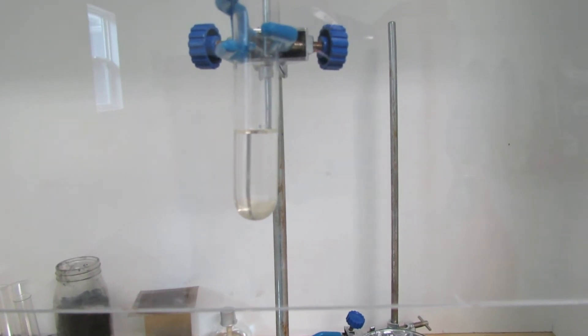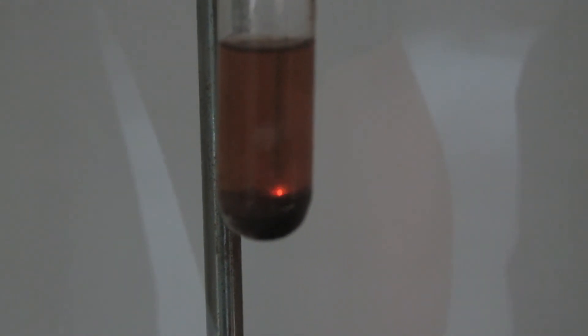So I'm going to get the potassium permanganate in there. Okay, so I dropped the potassium permanganate in there and the thunderstorm has started.